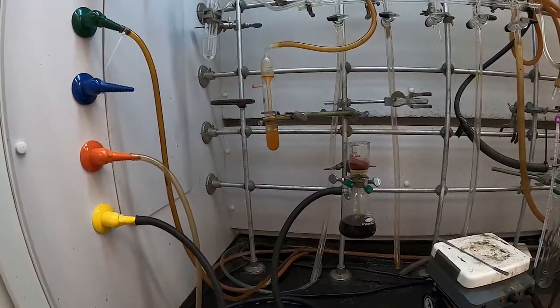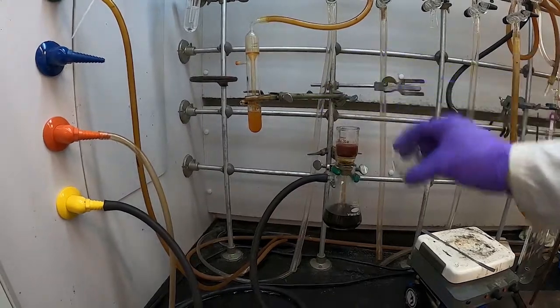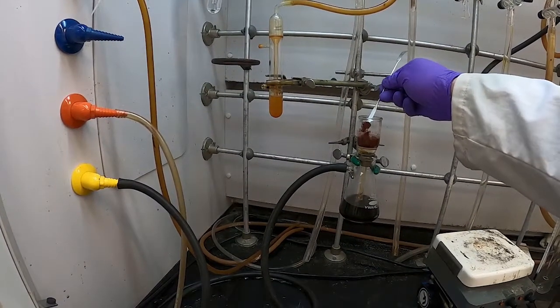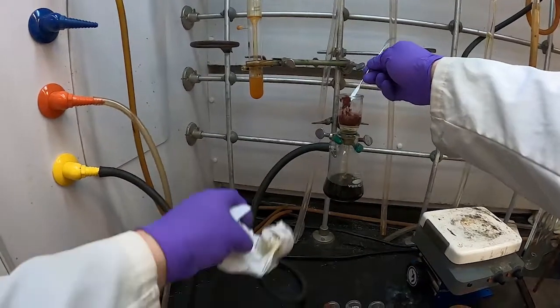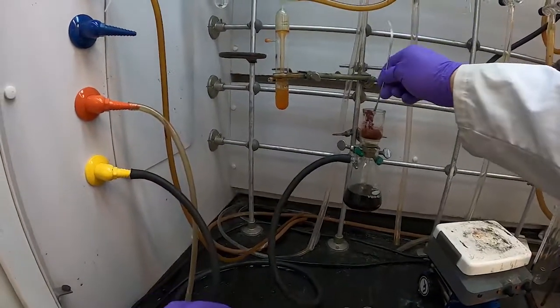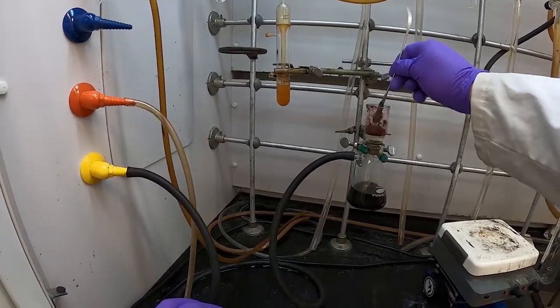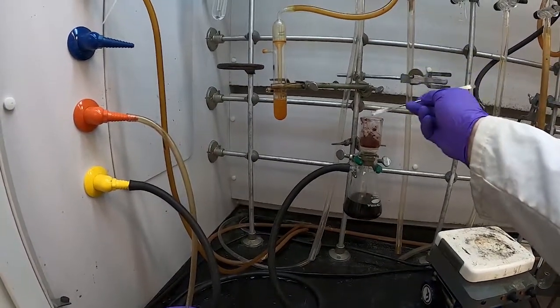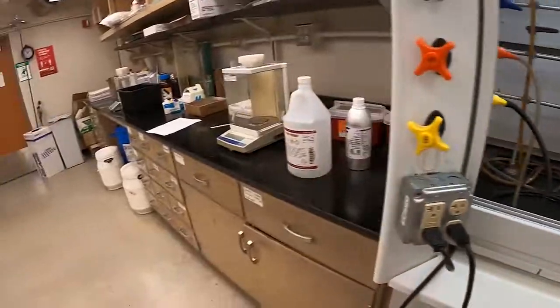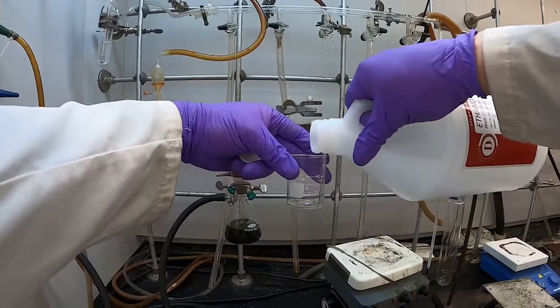So now we wash with five milliliters of water three times, so a total of 15. So I'm going to use a little of that to rinse out our flask. To do this washing, I'm going to shut off the vacuum. I'll add the water. I'll take my spatula so I can extract my stir bar too, and then stir the compound around a little bit.